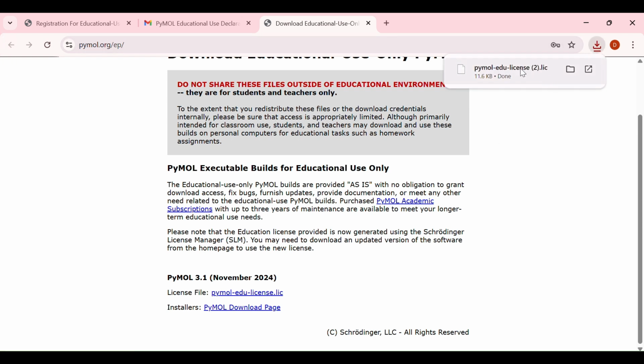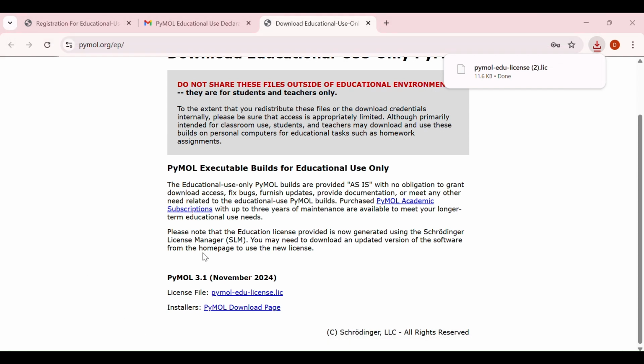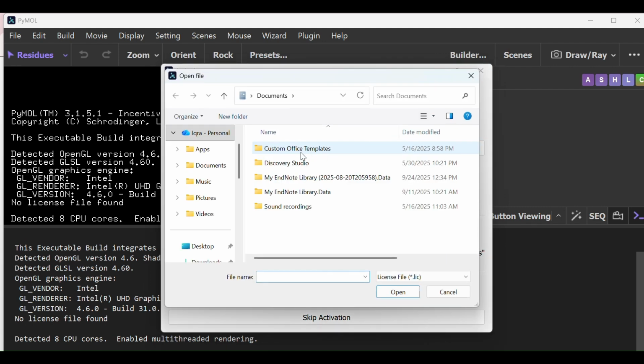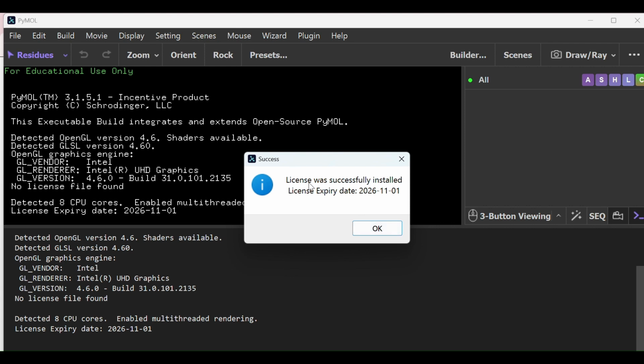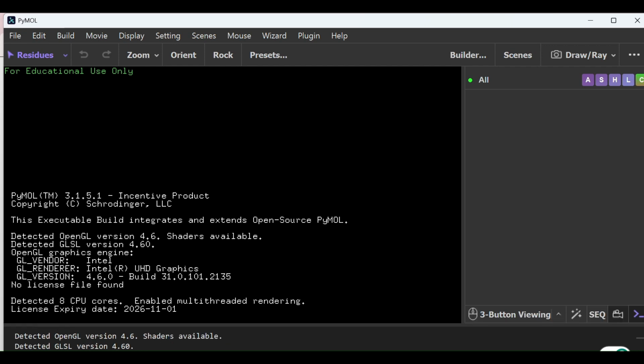It just downloads this license file, and now open your PyMOL and here to activate the PyMOL you have to browse the license file. I just enter it and it says that license was successfully installed, and just mention the expiry date too. Click on OK, and now you can use your PyMOL for research and education purposes.